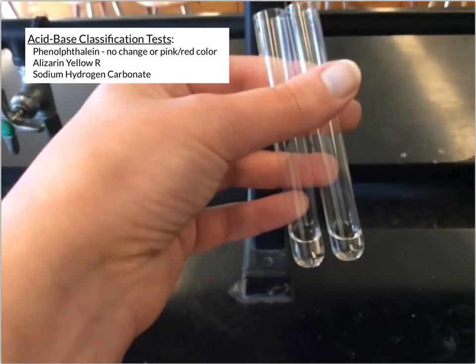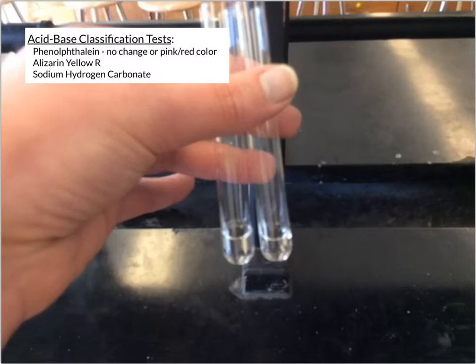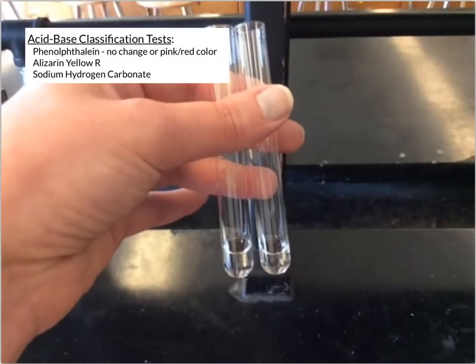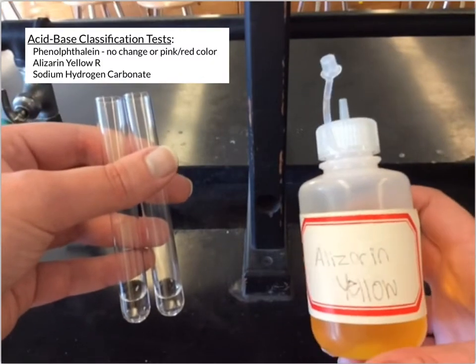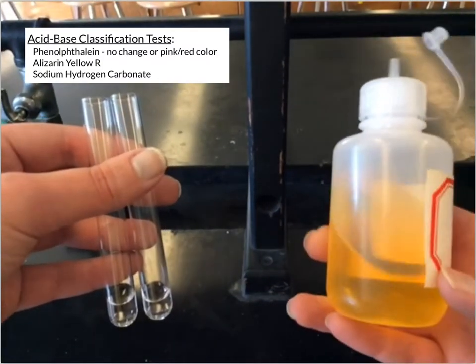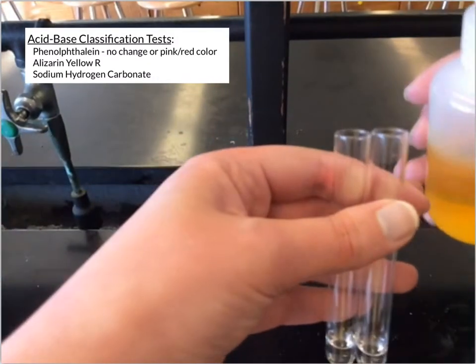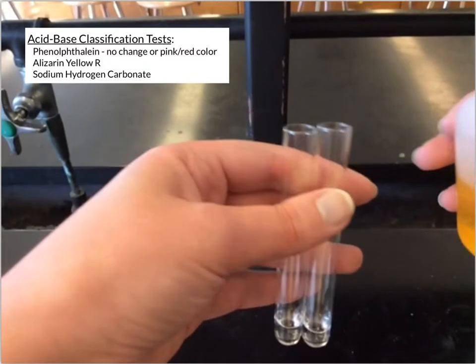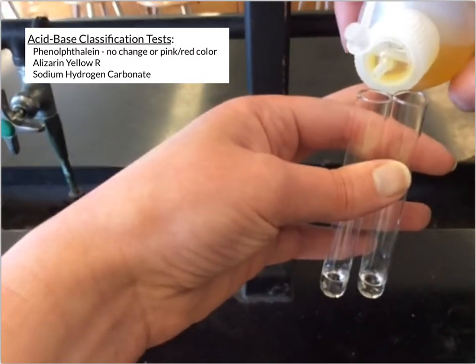Now I've got 2 more substances here, and we're going to test these with an alizarin yellow R. So this is another type of indicator. This indicator starts out yellow, and it can change depending on what type of substance you add it to. So again, I'll add a few drops to each test tube.